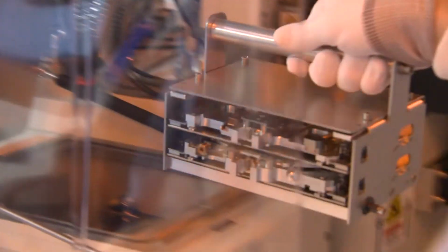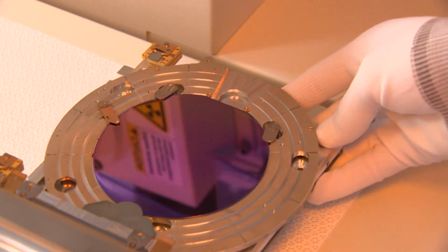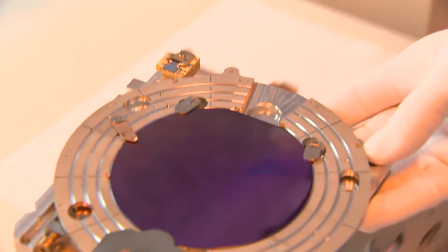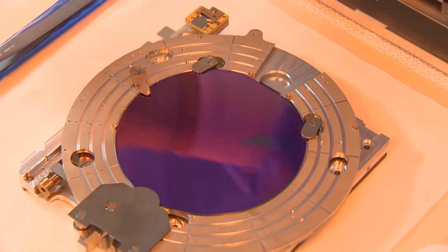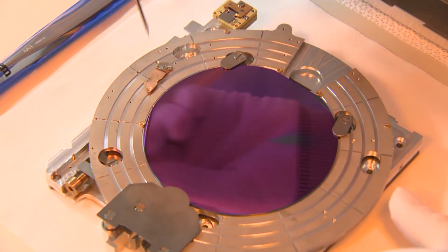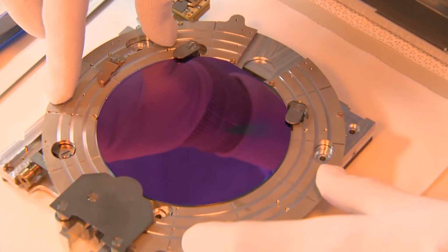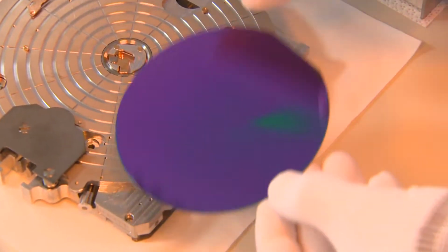For everything to turn out well, there must be nearly constant temperature in the laboratory all this time. We just have to watch our thermal expansions while we create the nano world. The same applies to purity. Dust particles hitting the silicon wafer could spoil the whole job. There should be less than 100 such particles per cubic foot in this laboratory.